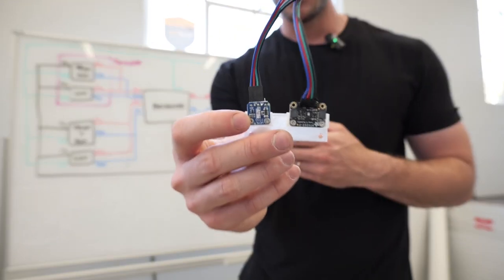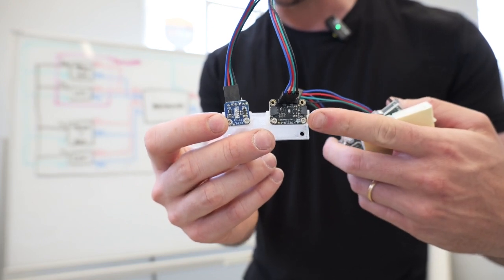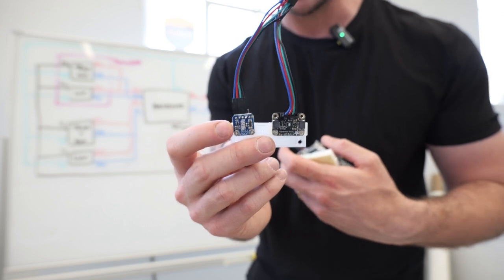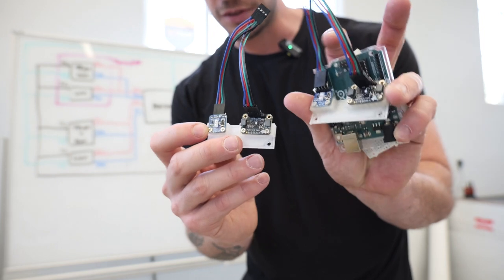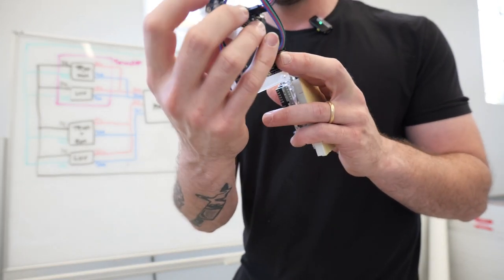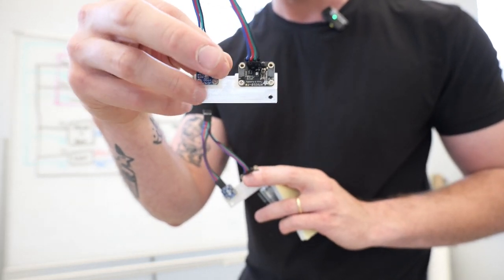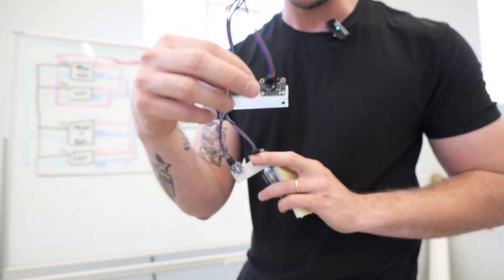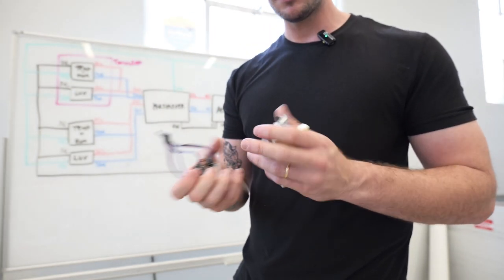I took some sensors that you can see here, and this is the sensor for the temperature and humidity, and this other guy is a sensor for light. And basically I made two copies of the same thing, and this little holder I just 3D printed in order to have those two holes. I can use those to screw it down on the twin leaf so that it stays nice and stable in position inside of the twin leaf.